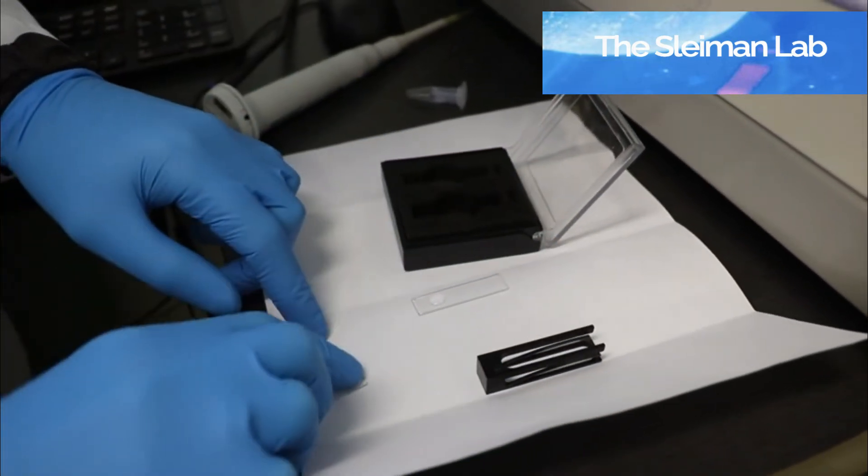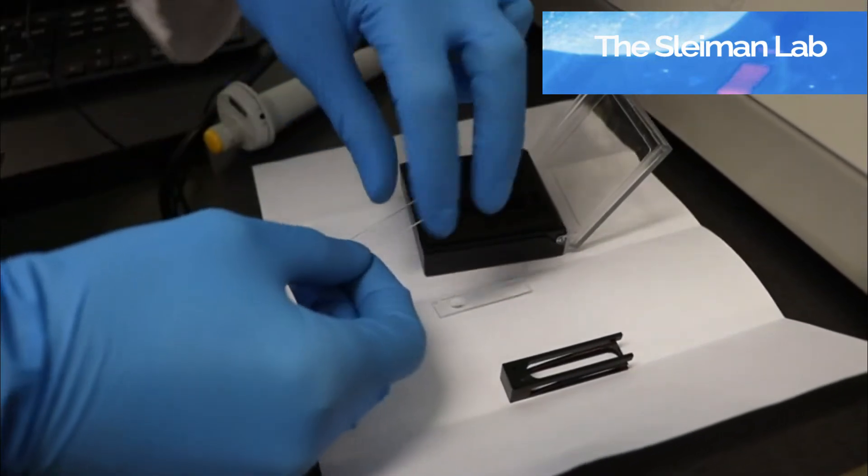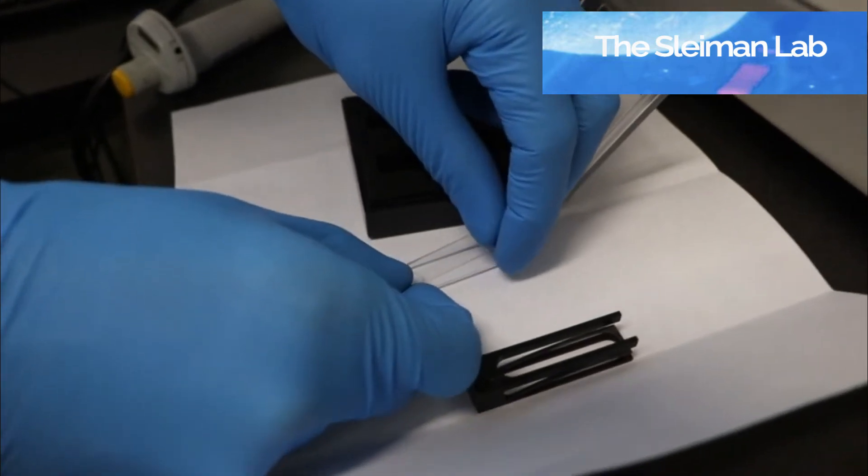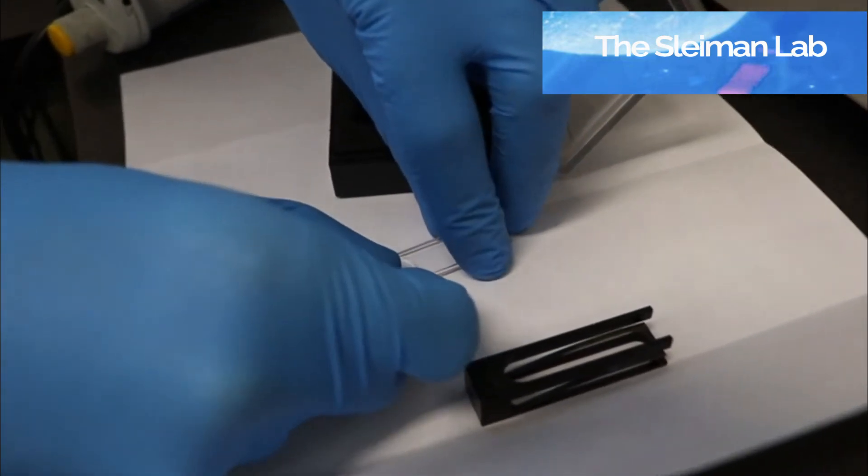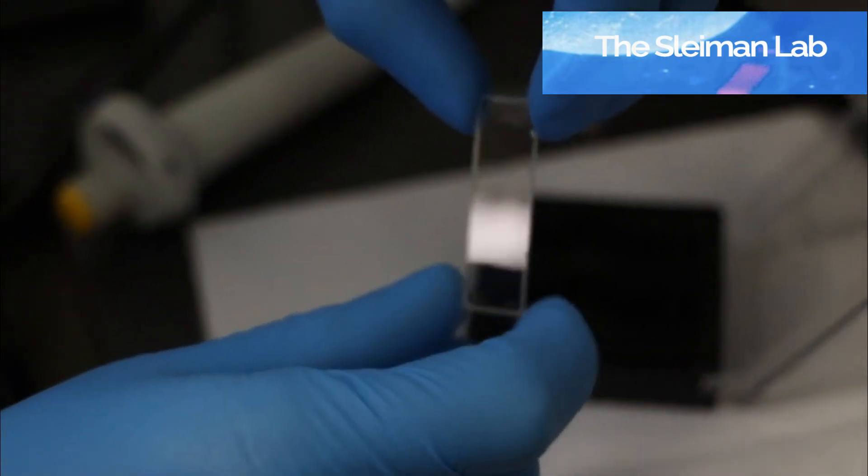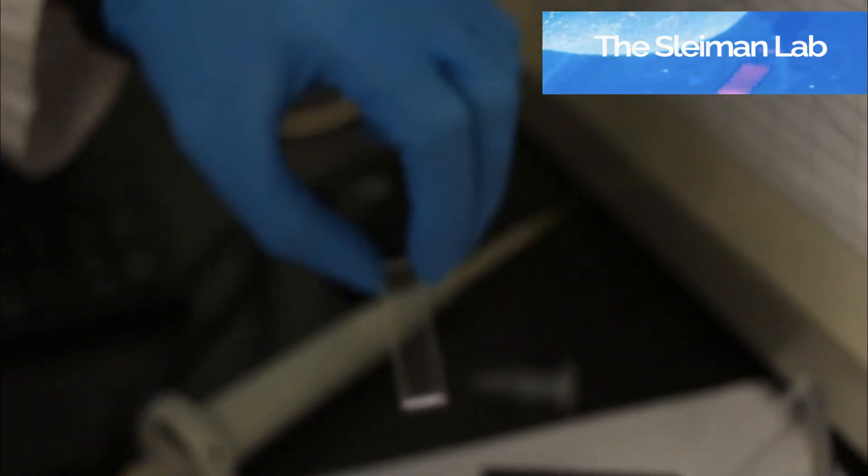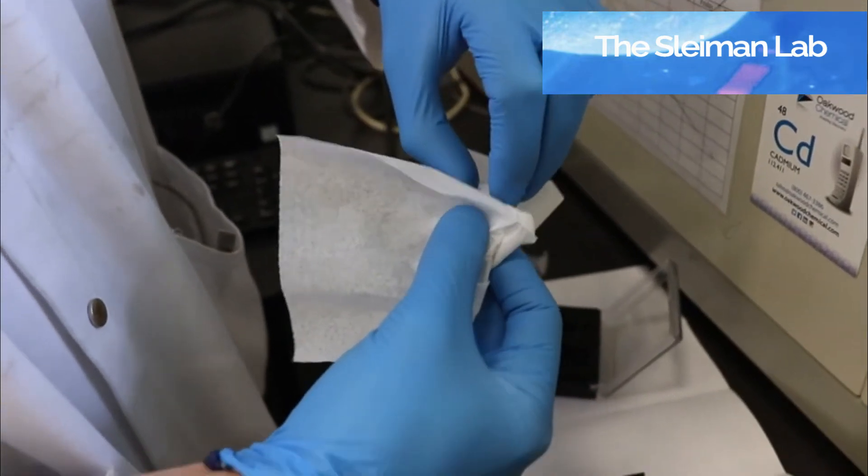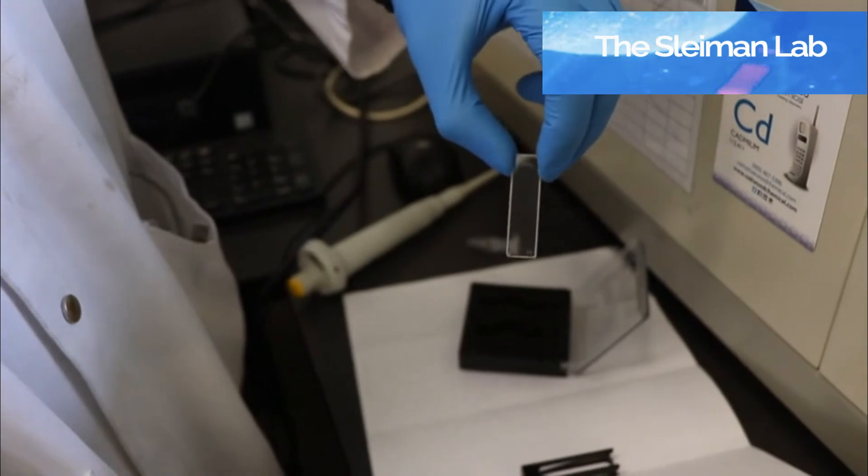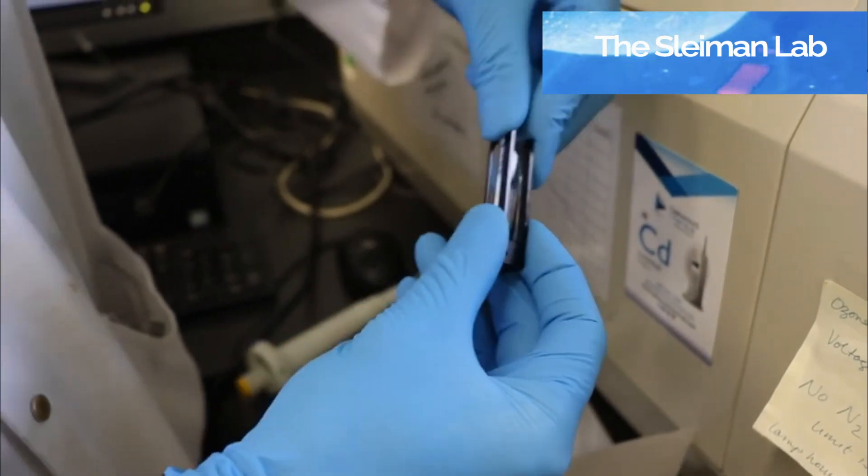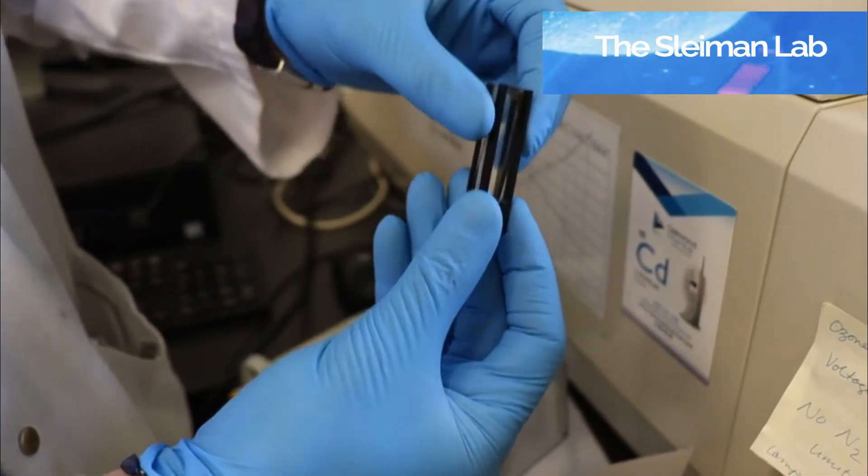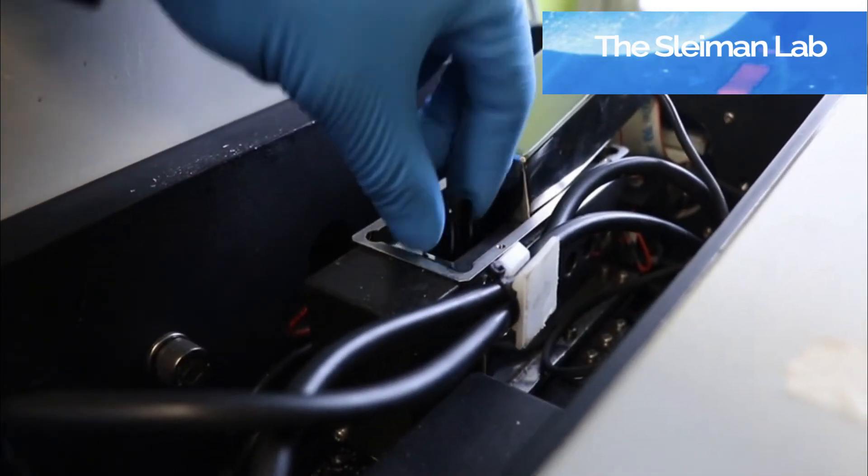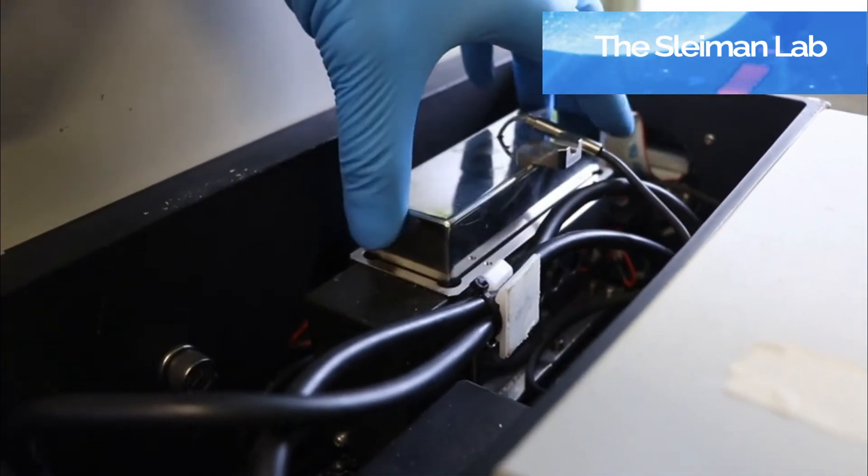We then take the cover slip and slide it over our sample. We now have our samples inside of the cuvette. Give it a little bit of a wipe with a Kim wipe. It's now clear. And use a sample holder like this. We can now place our samples in the first position and run our blank measurement.